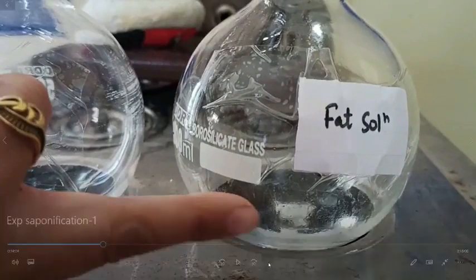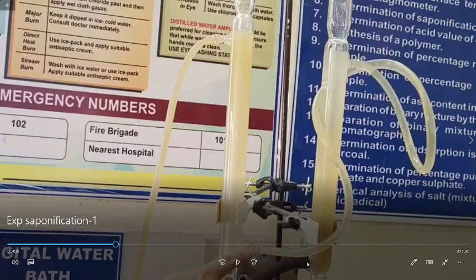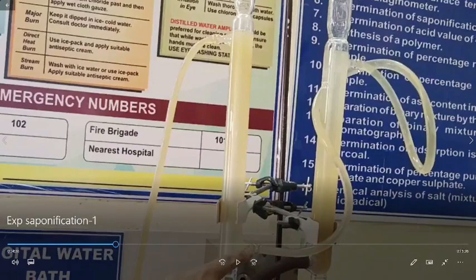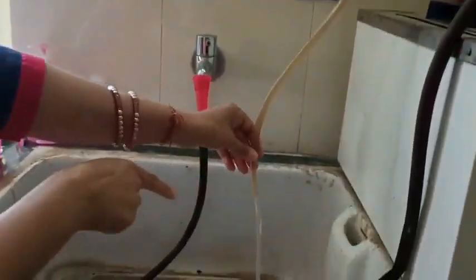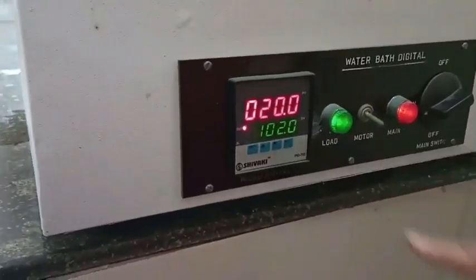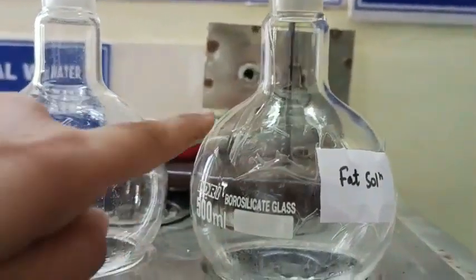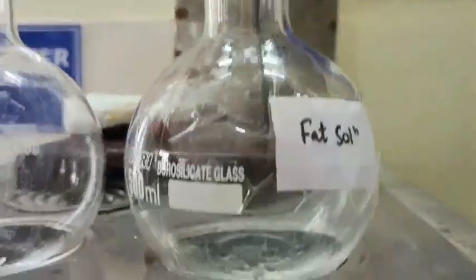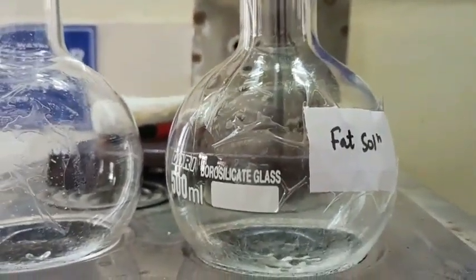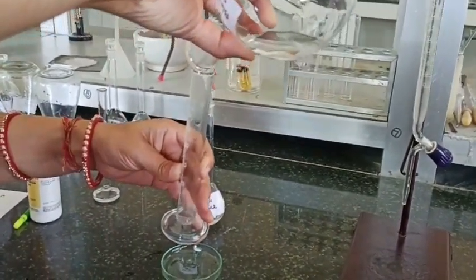Here is the water connection for condensation — the inlet is at the lower end of the condenser. Here is the inlet for the first condenser and its outlet, which is used as the inlet for the second one. This assembly is heated on a water bath. You can see the condensation of vapors — this is how the saponification reaction proceeds in the alcoholic solution of KOH. Now we are going to titrate this with 0.1 normal HCl solution.